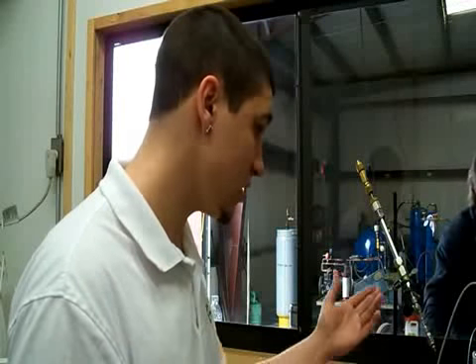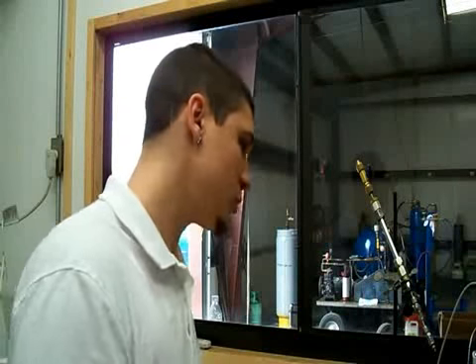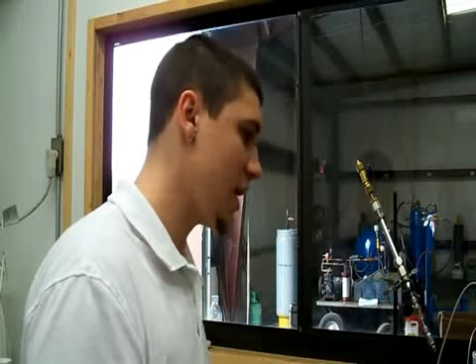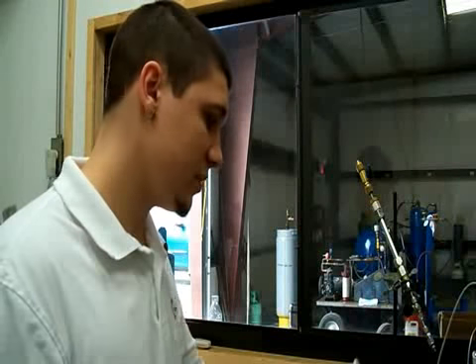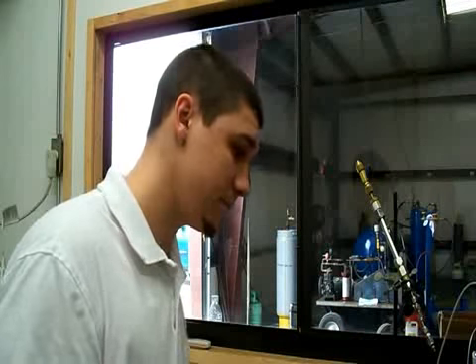So what we do here is we'll inject about an 18 to 20 gram sample of the gas that we have inside our shop, and it will be under a standard of 10. So we want a number of under 10, which is the water inside the sample that is actually in the gas.